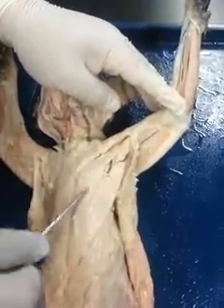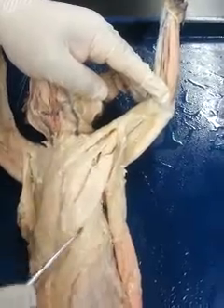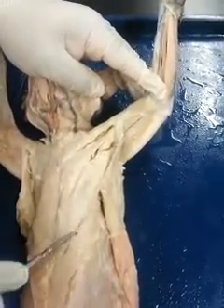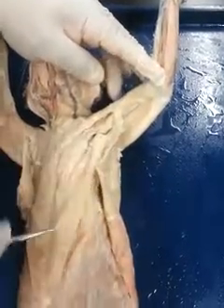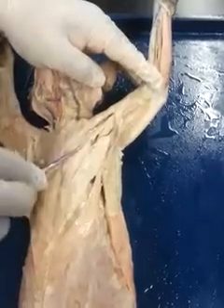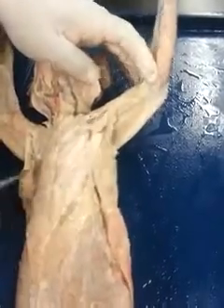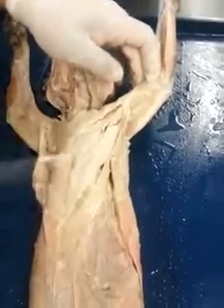Then we have the pectoralis major, pectoralis minor, and the xiphohumeralis. And this is another muscle you only find in cats, so we're not too concerned with it. So our major muscles that we really want to know here are pectoralis major and pectoralis minor. Remember, as far as the pectoralis major, it's going to allow you to rotate that humerus and bring it towards the midline.